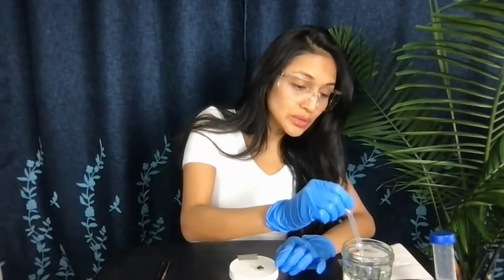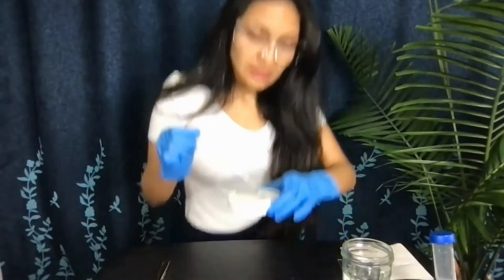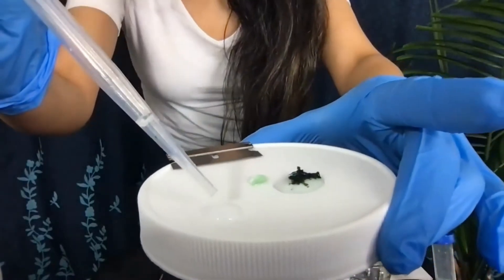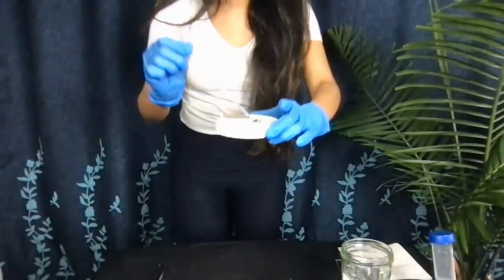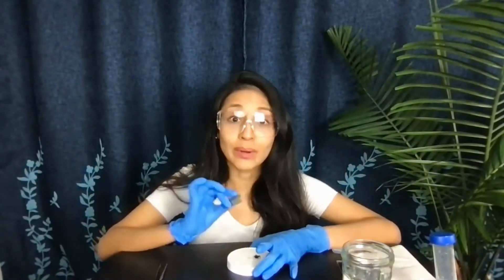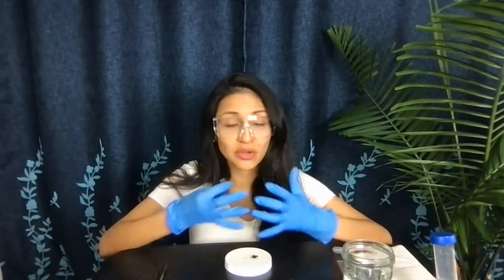What we're going to do is grab a new clean drop of water, put it somewhere on the side so it doesn't touch the original one, and then try to grab that teeny tiny amount. I grab just a teeny tiny amount and put it into the new drop. This is almost ready, but you want to chop it up even more — right now it's literally one-fifth of a grain of rice. I want it smaller, to the point that I can barely follow it with my eyes and just see a little green shade. That's as small as I want it, because if you have too much, under the scope you'll just see a blurb and won't be able to distinguish the shapes and beautiful colors of these organisms.